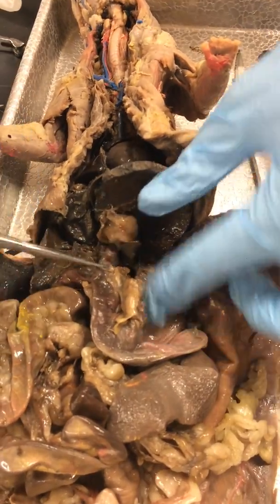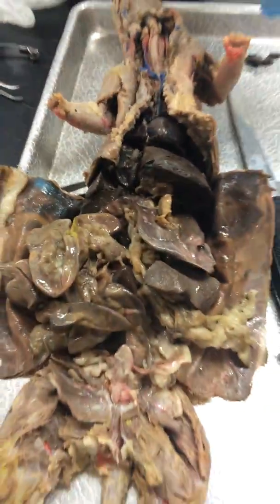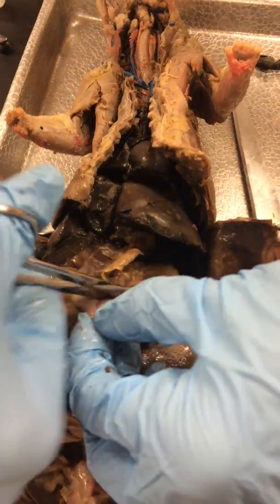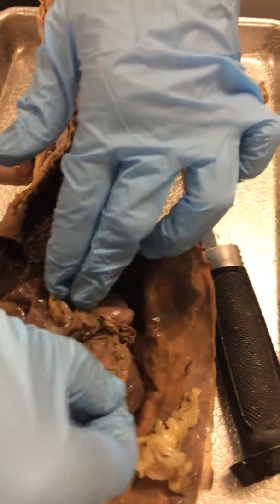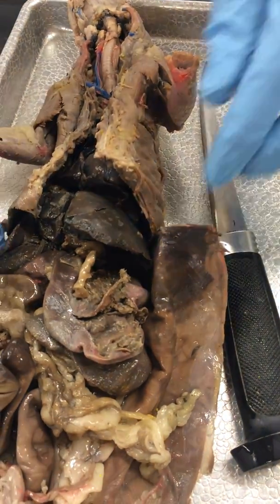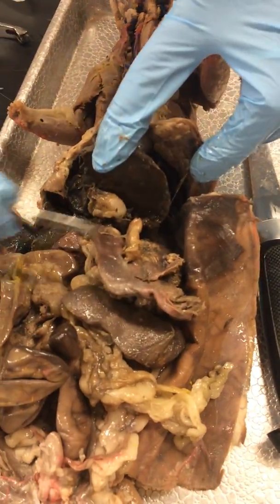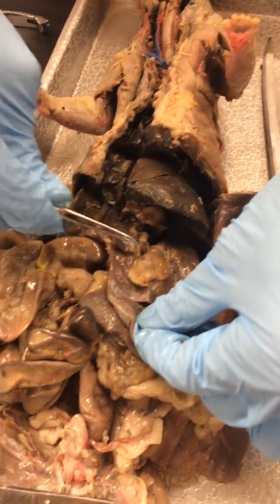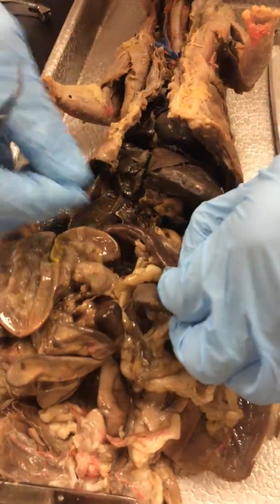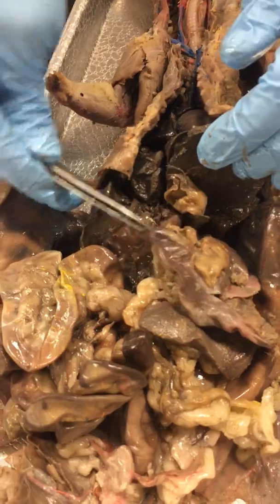And then the stomach, if we were to cut it open with some scissors, you can see the rugae inside. So those are just folds that allow the stomach to expand. So you can see some of them. This one has some food. It was already pretty expanded, but the rugae are the folds on the inside of the stomach. And then the greater curvature is on the bottom of the stomach, the lesser curvature on the top of the stomach. And then the pyloric sphincter and region is down here at the end, right before we get to the duodenum.